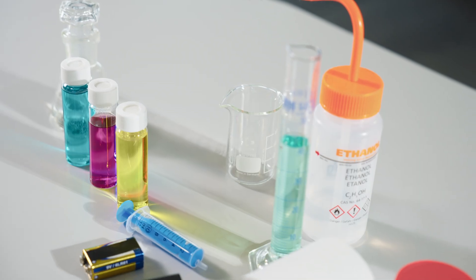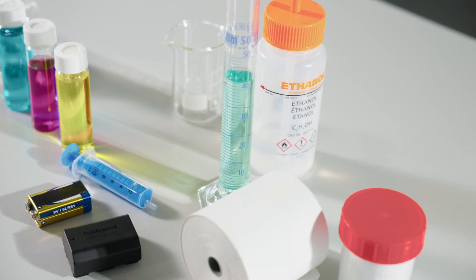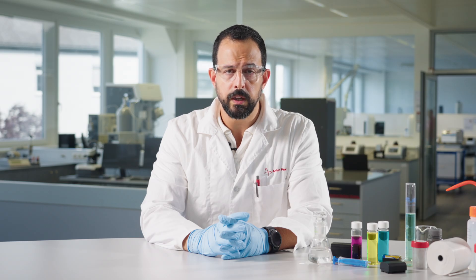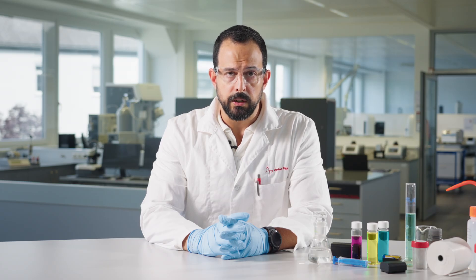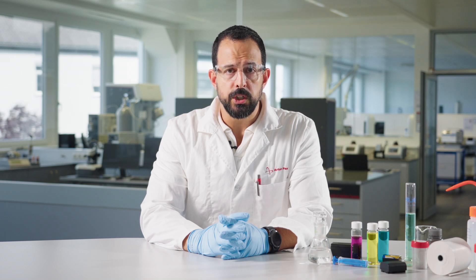Let's start with density. Density measurement of an electrolyte solution is a quick, easy, and very reliable way to ensure that the composition corresponds to the specifications needed. Density measurement is also a great QC tool during electrolyte formulation preparation. You can do a quick density check with a portable density meter, and for a more accurate measurement, a benchtop instrument is used.